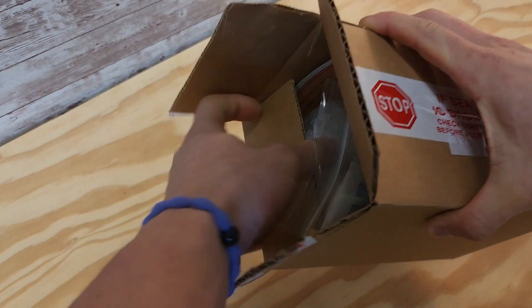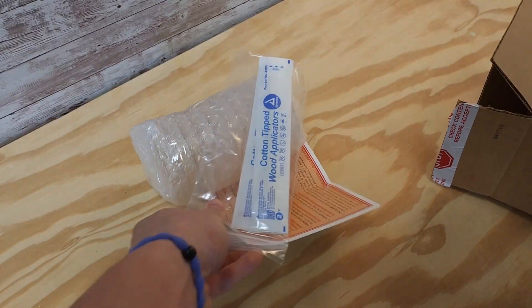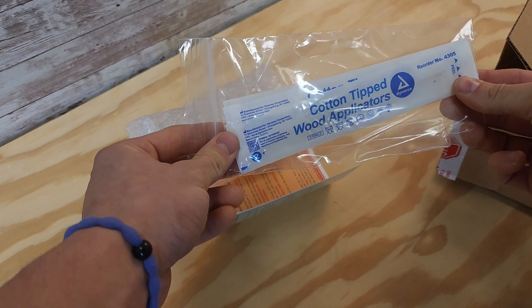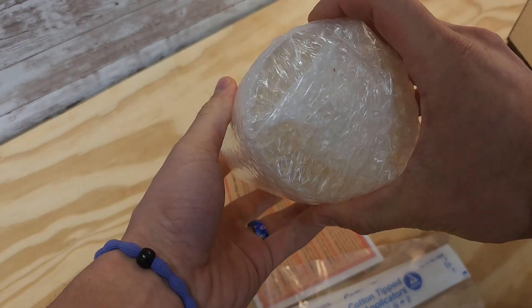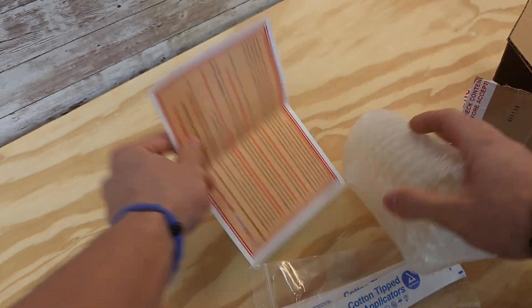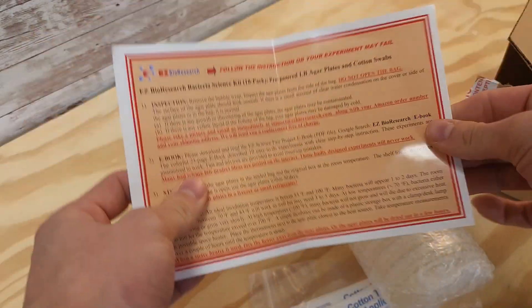I'm going to try to grow some bacteria. Here's the process: I'm going to have four dishes — one control where I don't swab anything, and then I'm also going to swab a toilet. Yes, gross, but I think it's important to have something gross to see and compare things we often don't think about as being gross to what we do think is gross.